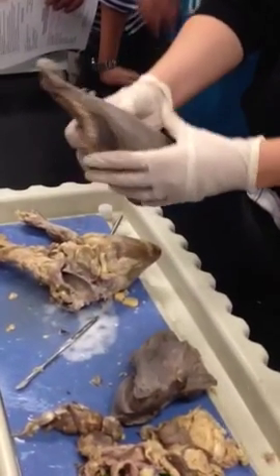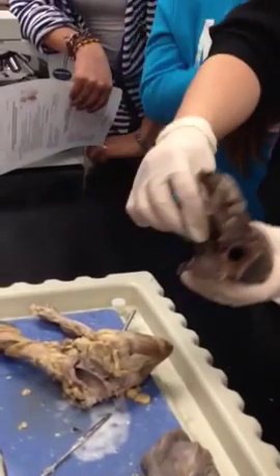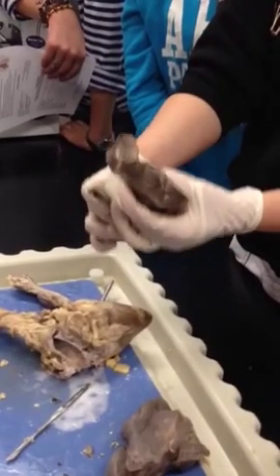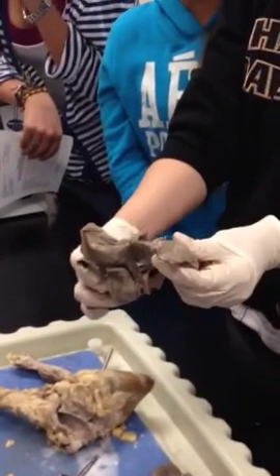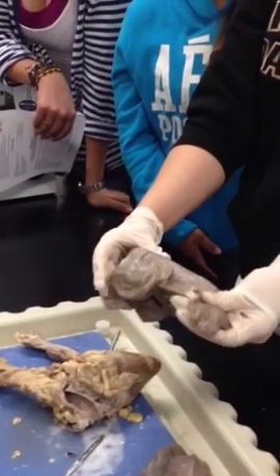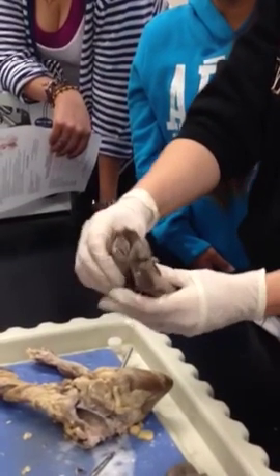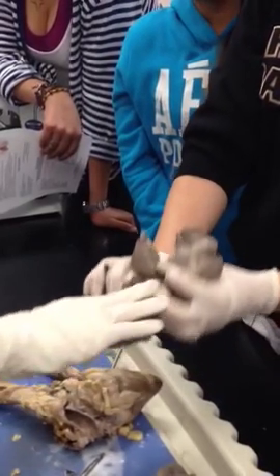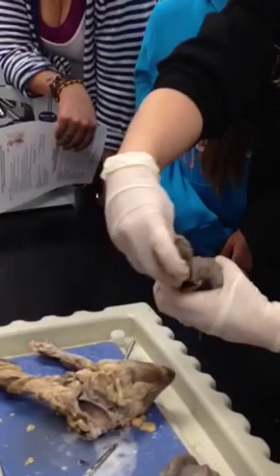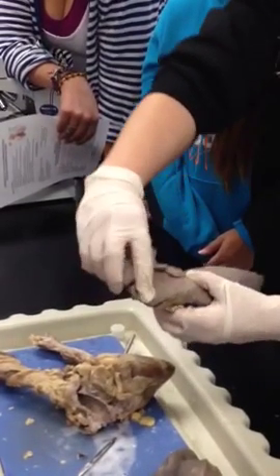Okay. So this is the right superior, the bottom, this is the middle, and the inferior on the sheep is very large. The superior is very small, but the middle one barely looks like a lobe. It's like in between. The inferior, you said, or the superior? This is the superior. It's just part of this lobe.